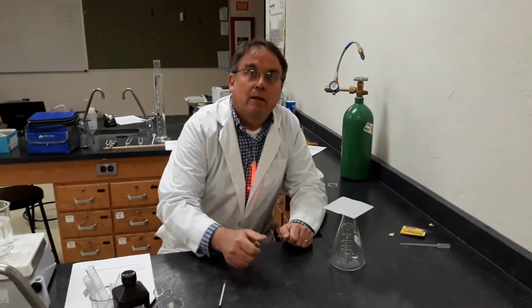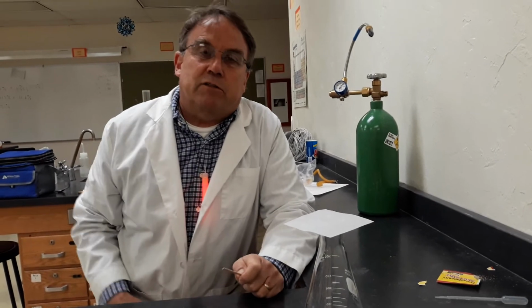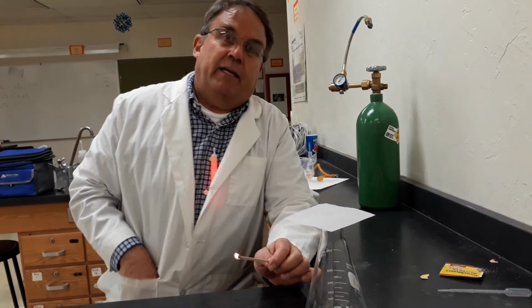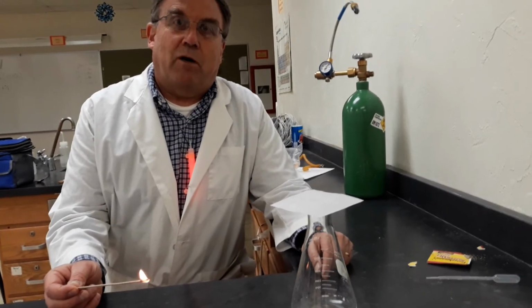Awesome. All right, so I have one more demo just for the fun of it. I mean, just for the sheer learning experience. This one goes back to the effect of concentration. We know that wood burns in the presence of air because air has oxygen in it, but only 21% oxygen. Here I have a flask that theoretically is pure oxygen.